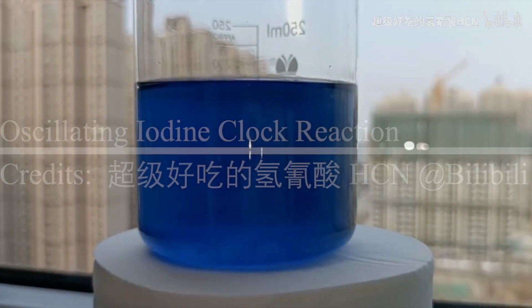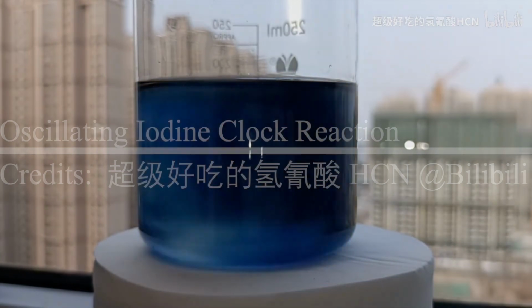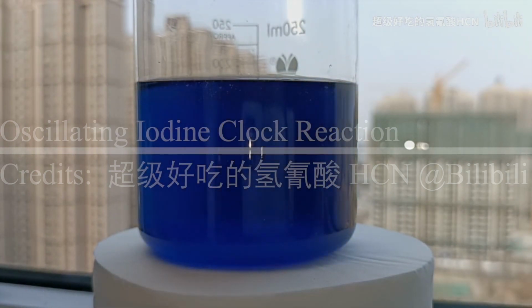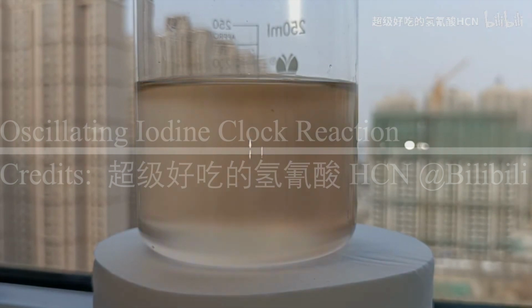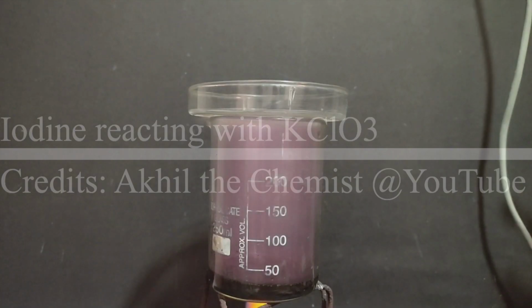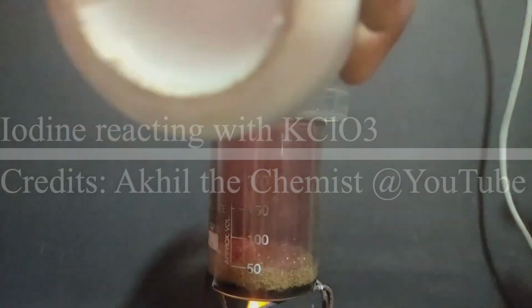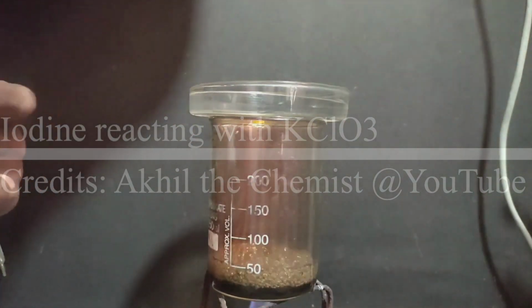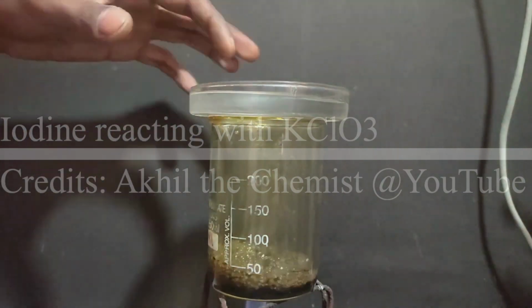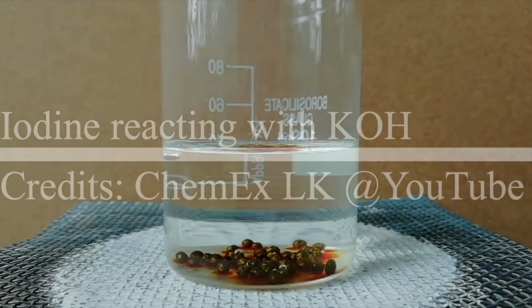Hi, here is MIH. Recently I have been exploring some color changing reactions and I wanted to recreate the oscillating iodine clock reaction. For this, I need potassium iodate. The industrial method of manufacturing it is reacting molten potassium chlorate with iodine to produce potassium iodate and chlorine. In the lab, adding iodine to potassium hydroxide can yield potassium iodate conveniently.